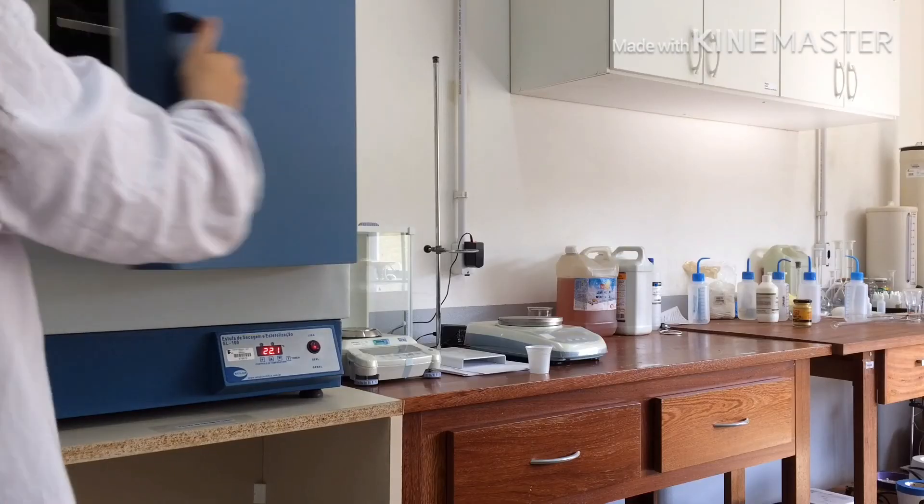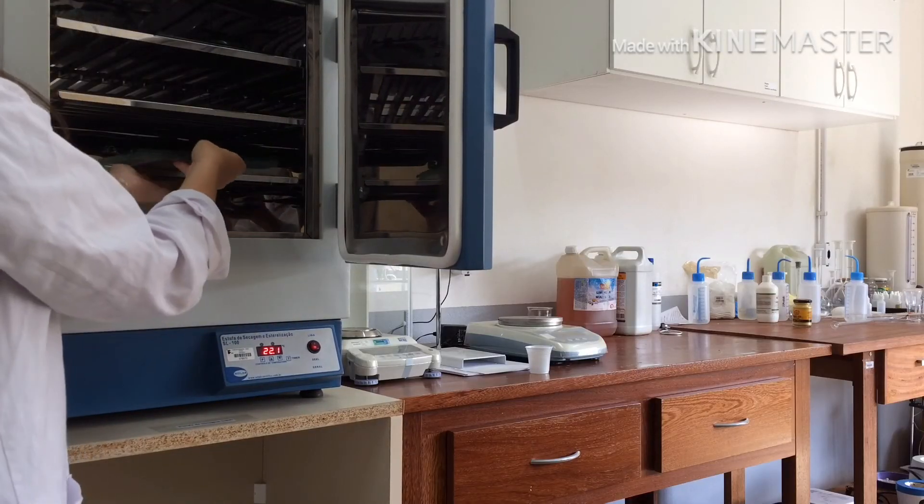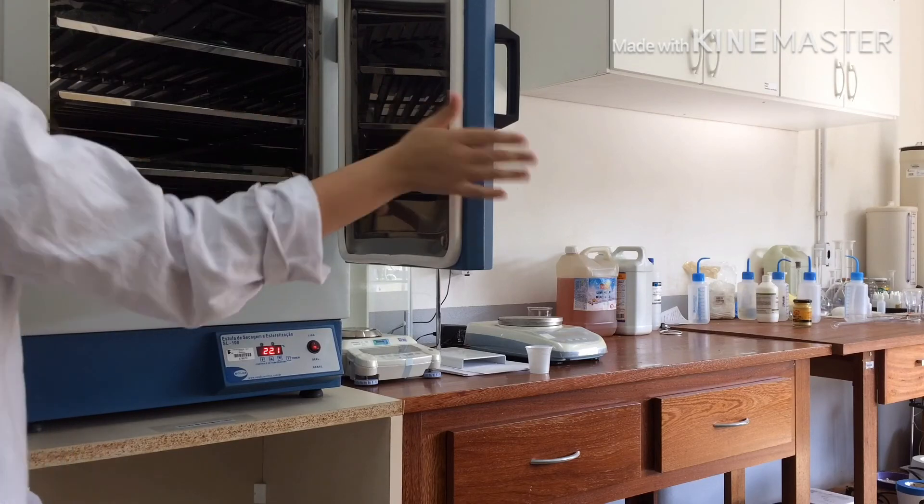I'll try to make films now. Dry at 60 degrees. You can leave outside but humidity of the place affects the final results of the film.